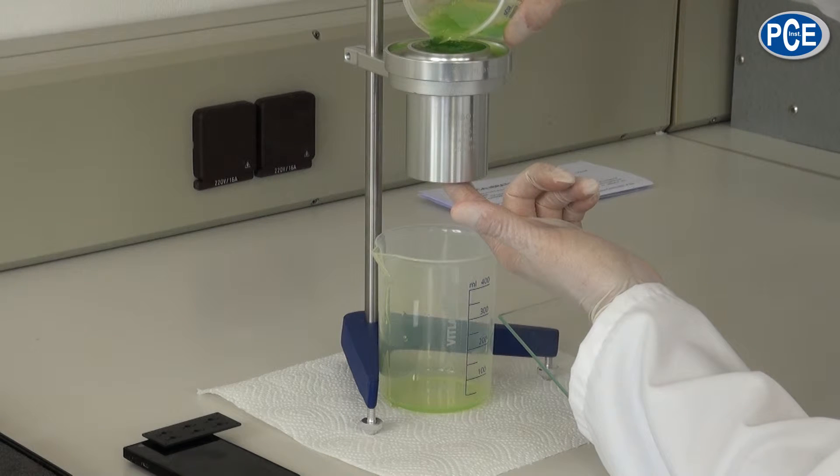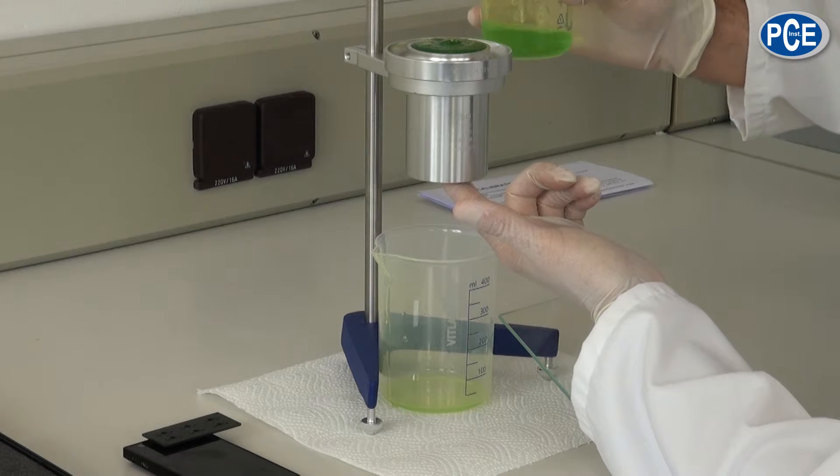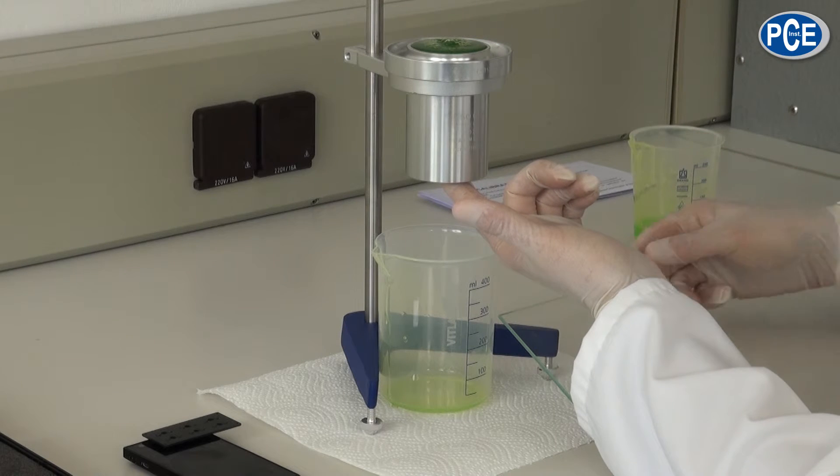When the fluid goes over the rim the excessive fluid can be removed with a glass plate.